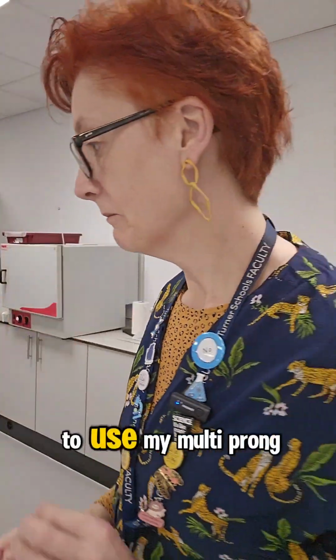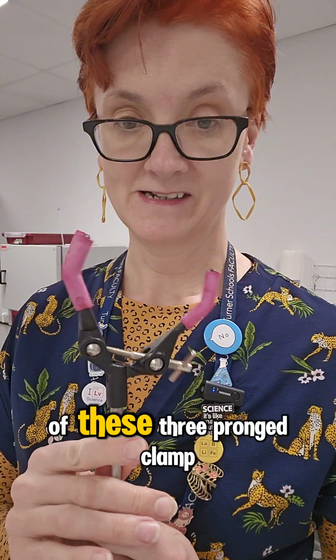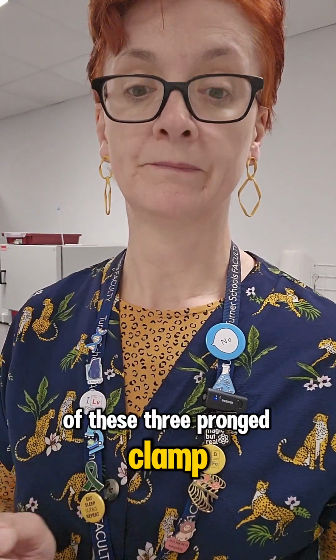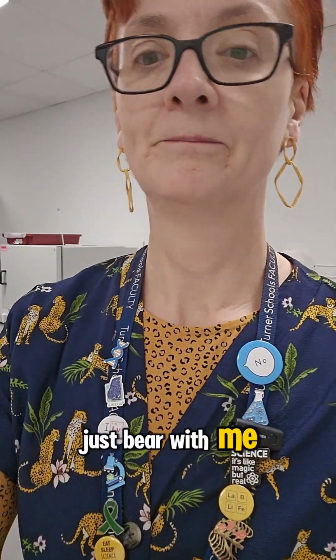Now I remember I have to use my multi-prong approach. I'm using a clamp stand and one of these 3-pronged clamps. And so now I will be using 6 prongs in total. Just bear with me. You can see what I'm going on about.